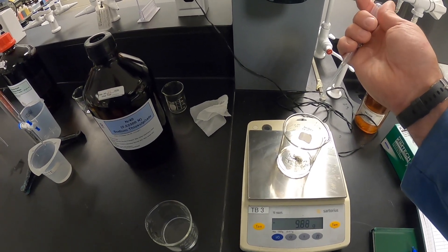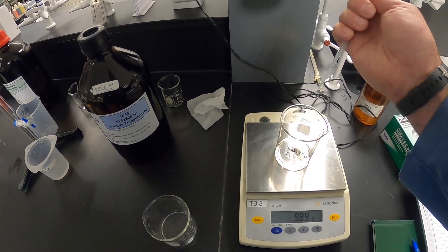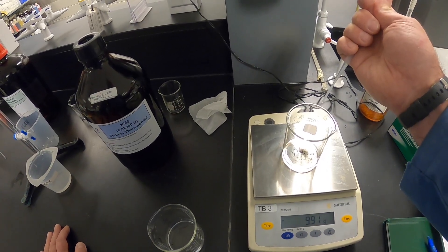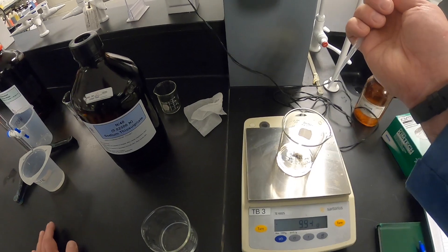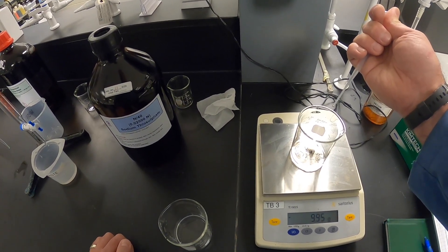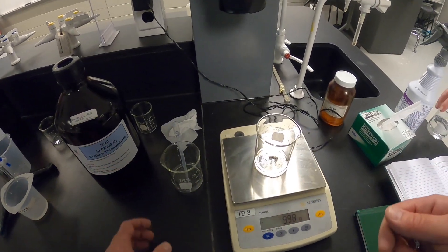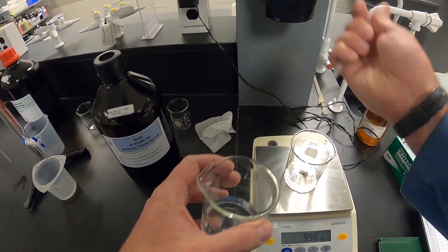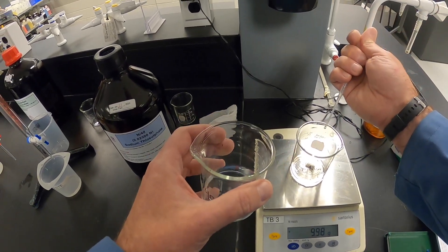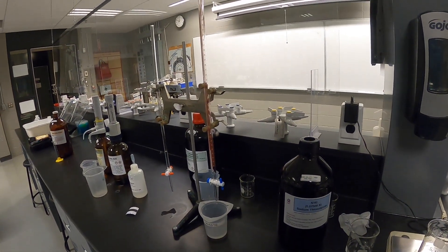You might be asking yourself why we're doing a dilution like this. If you look at the chemistry and the math behind it, we're creating something called a titer. This titer is a chemist's way of being lazy — it allows us in a very simple and straightforward manner to manipulate the chemistry ahead of time so that we don't have to do the math afterwards.